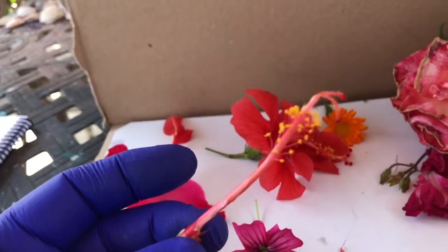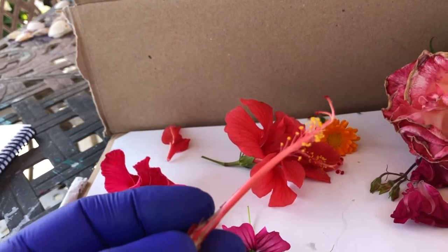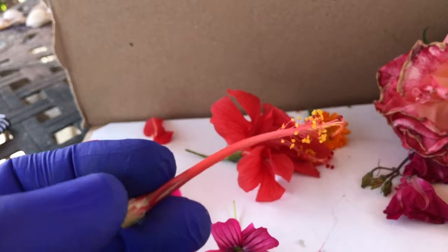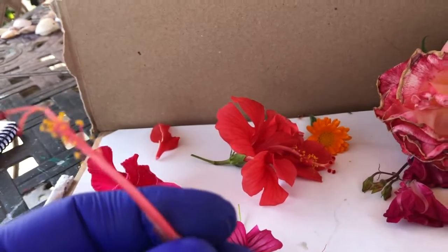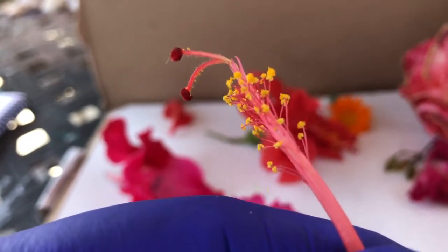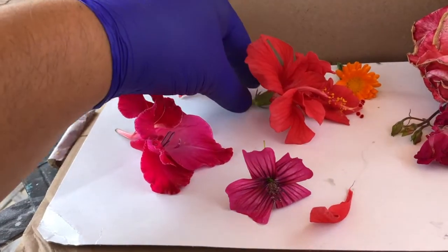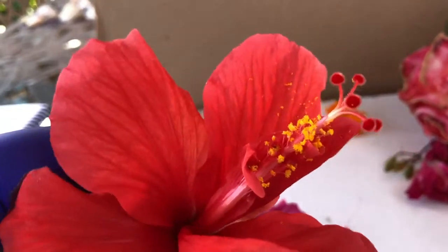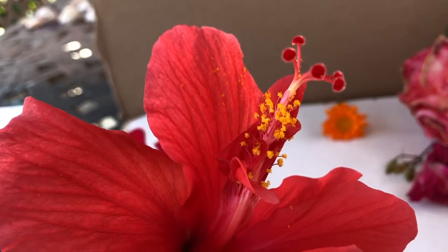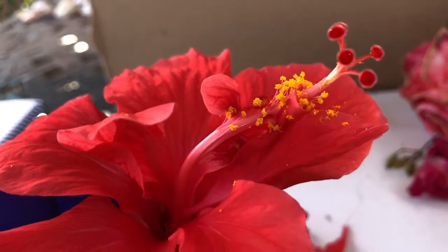Pistil. And so the pistil is actually pretty cool because it's actually the male and the female part of the plant. And this one here specifically, although the pistil itself is the female piece, you'll see that on this pistil here, those little granules of pollen are actually the male parts of this flower here. So if we were to take a look at the flower again, we'll see that both the male and the female parts are along the same region. It's not exactly the same for all flowers, but on this specific flower, the male parts seem to be growing off of the general female part.